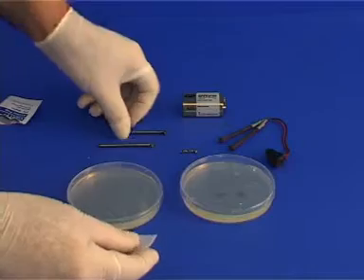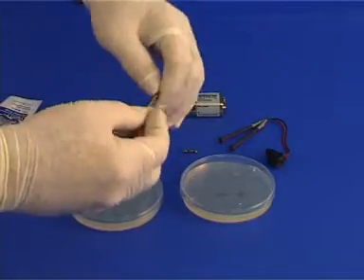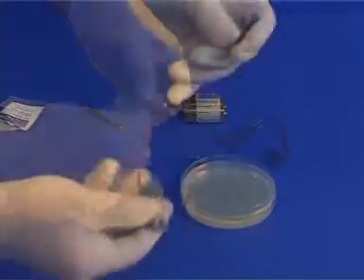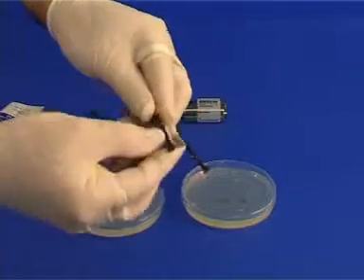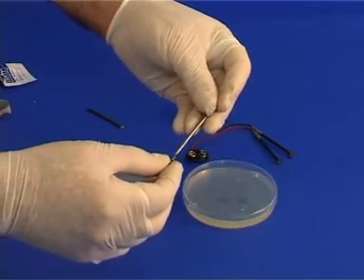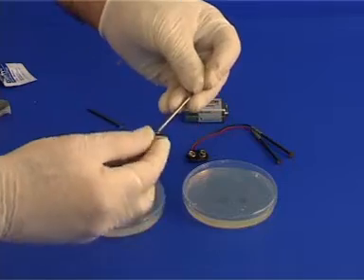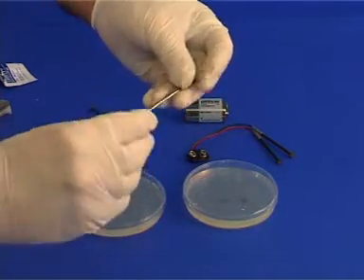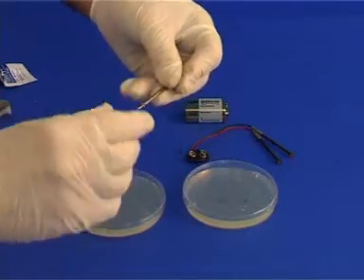First let us take an alcohol pad and clean the nails. Next let us attach the coiled magnesium strip by screwing it on the nail. Ensure that the coil is attached firmly to the nail and that it is in the middle of the nail.